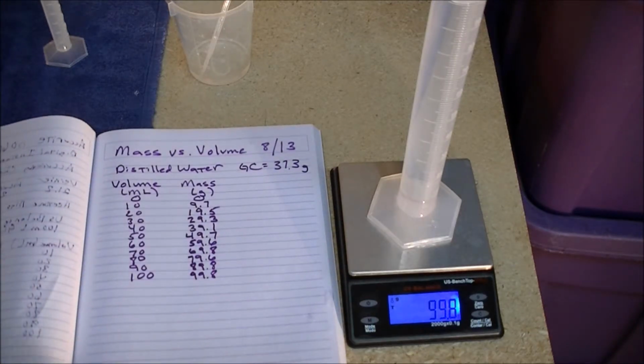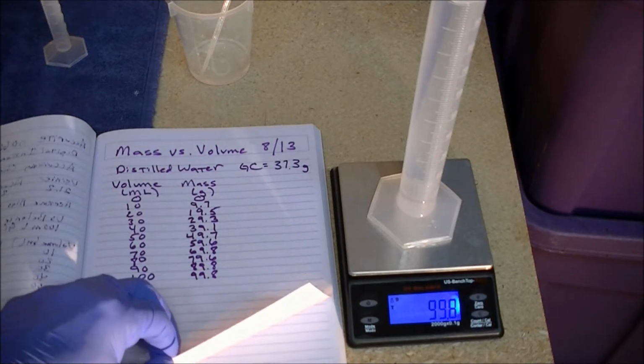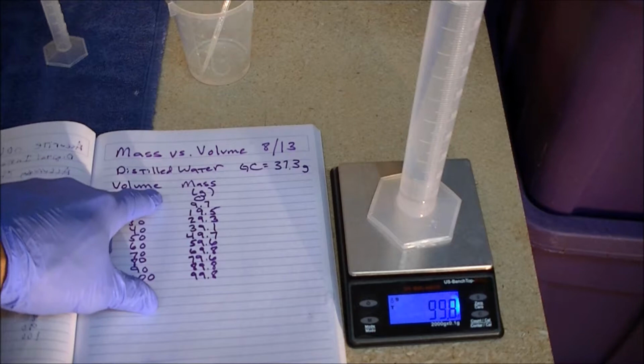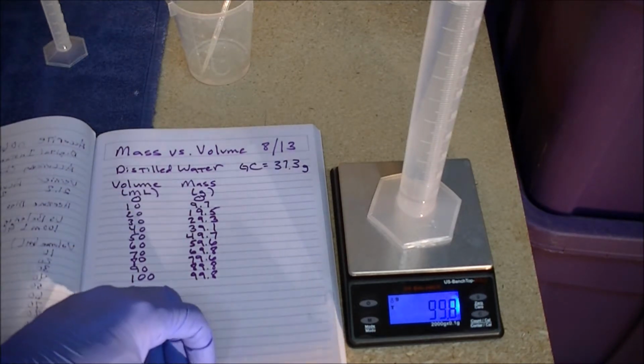That concludes what I ordinarily like to call the experimental portion of a lab, when one actually collects the data, or at least we've got the first third of it done, right? We've concluded the experimental portion for the material of distilled water. We still have to do isopropyl alcohol and acetone.